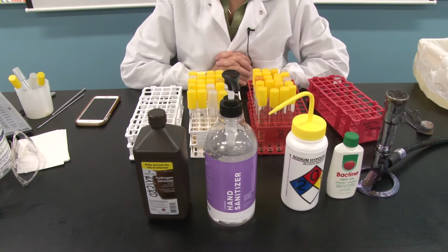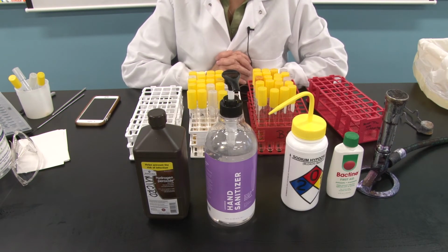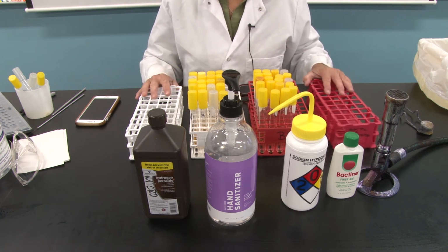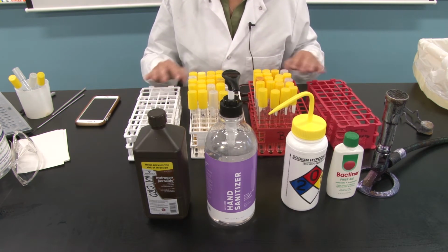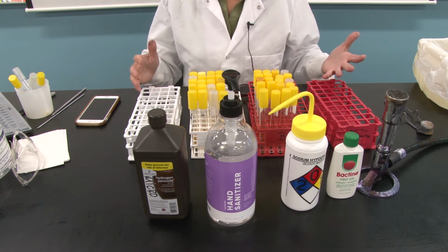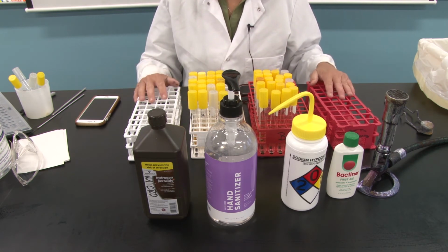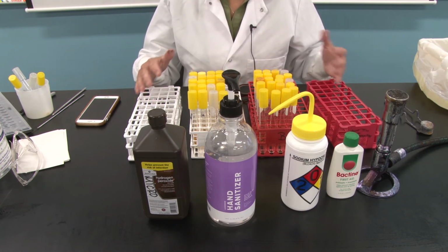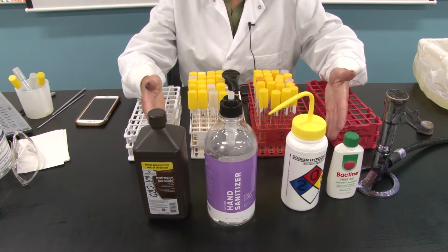Okay, for this section of session 7, we are going to test various antimicrobial agents, very common antimicrobial agents, and you were asked to bring a cleaning or disinfecting product from your household to today's lab. Because we cannot canvass the entire class's household cleaning products, instead of doing 24 different cleaning products, we are just going to do the 4 I have in front of us.